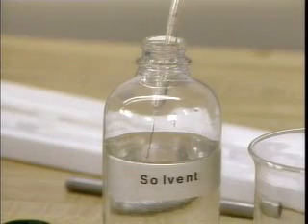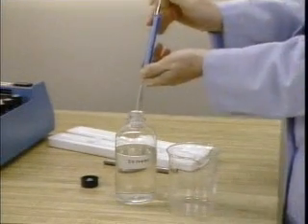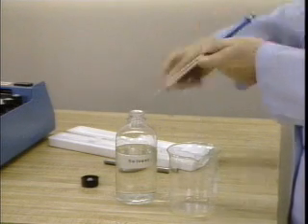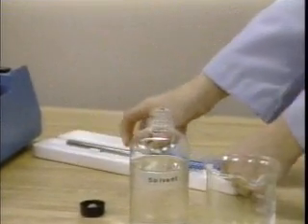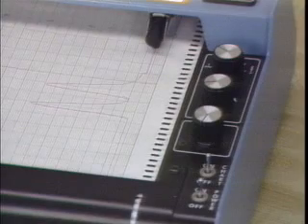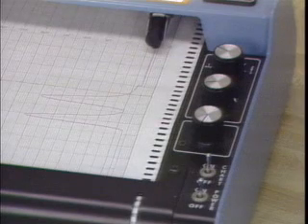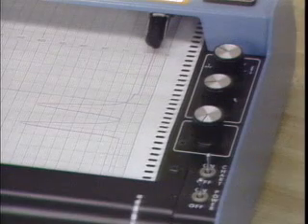The syringe is then rinsed several times with clean solvent. The sheath is placed over the needle, and the syringe returned to its storage container. Only after the sample has come completely off the column should another sample be injected, if necessary. When satisfactory chromatograms of the samples have been obtained, the chart paper drive is turned off.